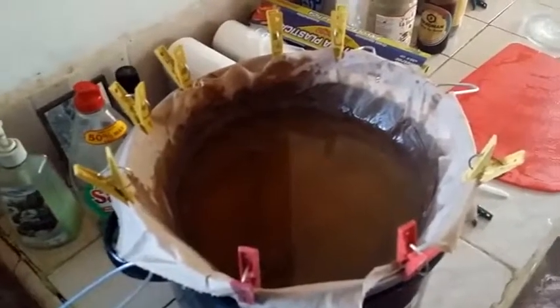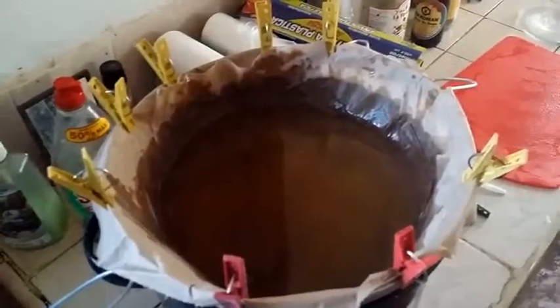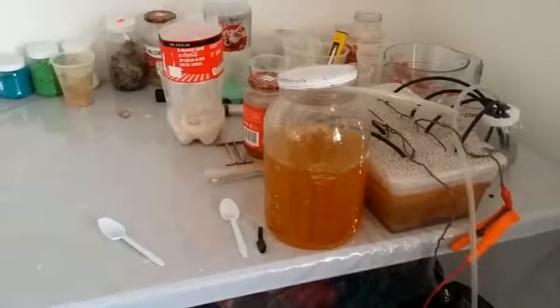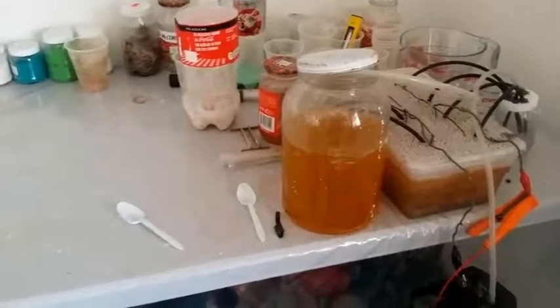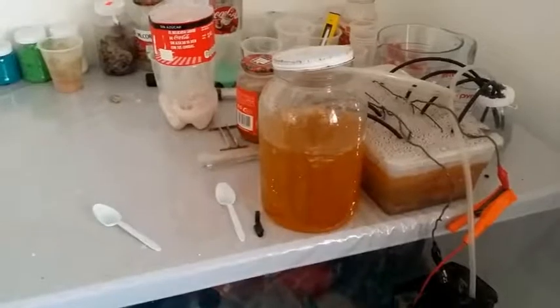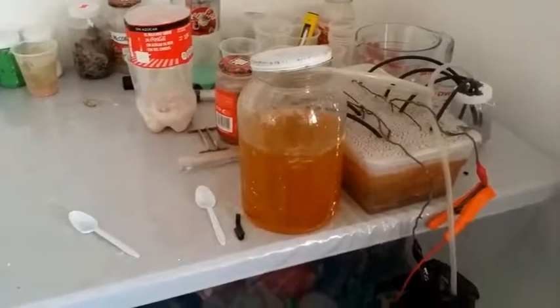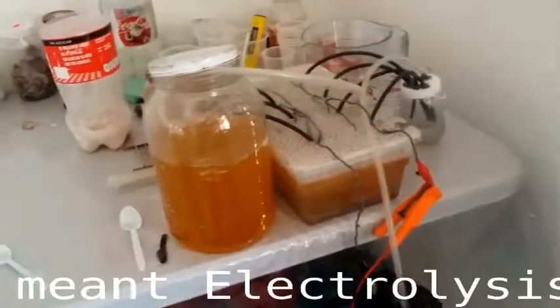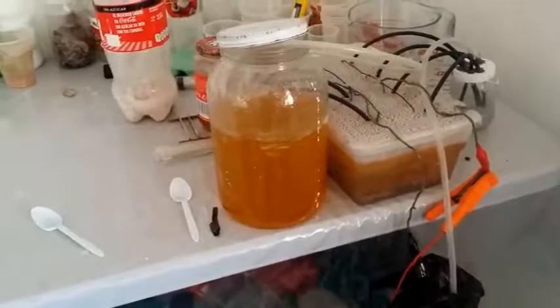Once this is done, I'm going to run a pass of oxygen through it for a number of days. I've had it running now for about 48 hours — I've been bubbling oxygen through it with my little water electrolysis system, and of course I've also been producing hydrogen, which I just generally keep releasing outside.